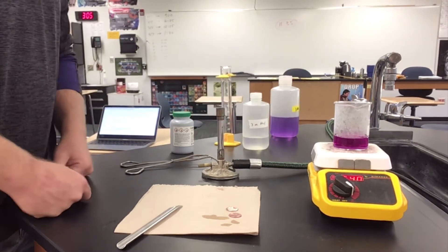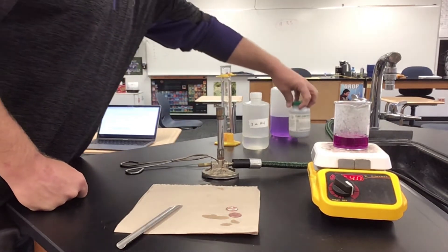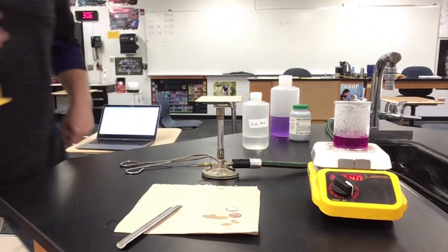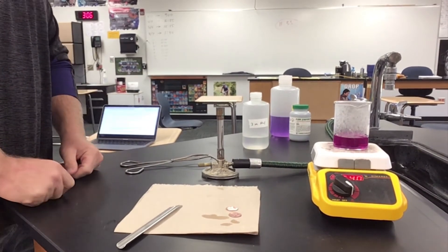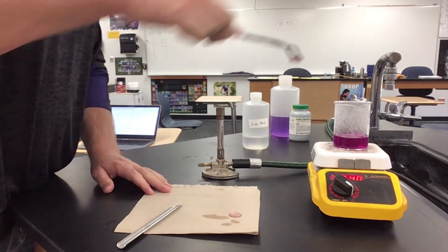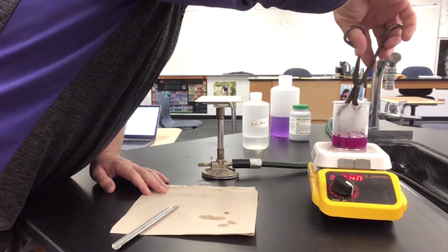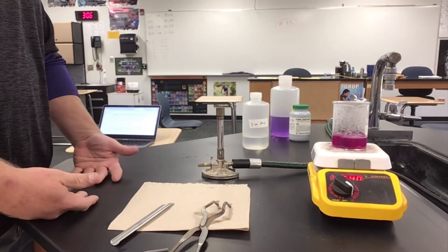You can hear this is close to getting ready to boil. The pink color has nothing to do with the actual experiment — it's just there to provide color contrast for the video. I'm done with my zinc powder and graduated cylinder, so I'm going to rinse that out and get it off my station since graduated cylinders can fall and break. Looks like I've got a boil started, so I'm going to add my pennies to my mixture and keep them separate from each other but let them both be in at the same time.